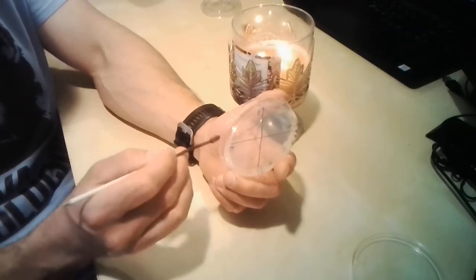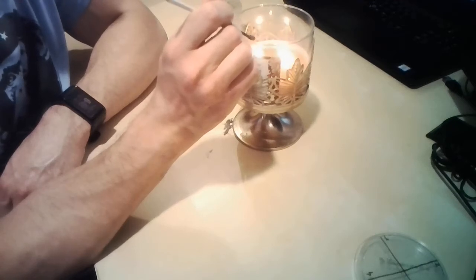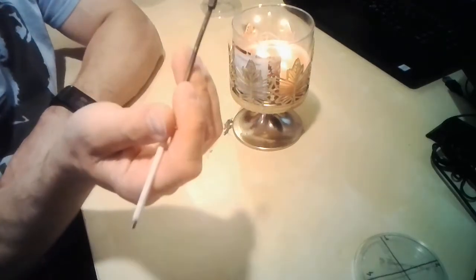Okay. I need to sterilize the loop again. And I don't know if you see that.